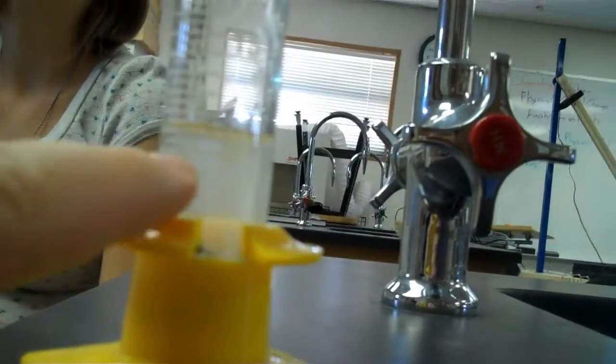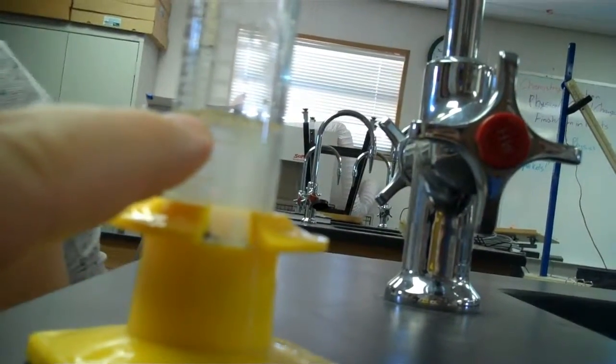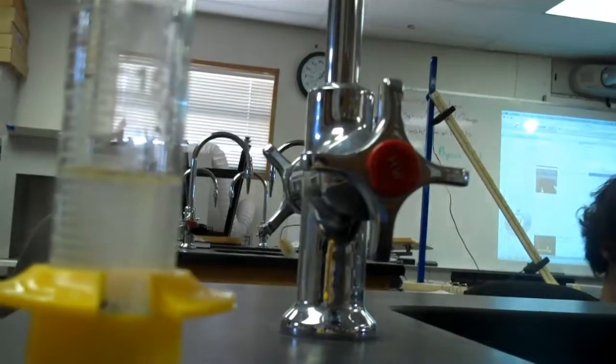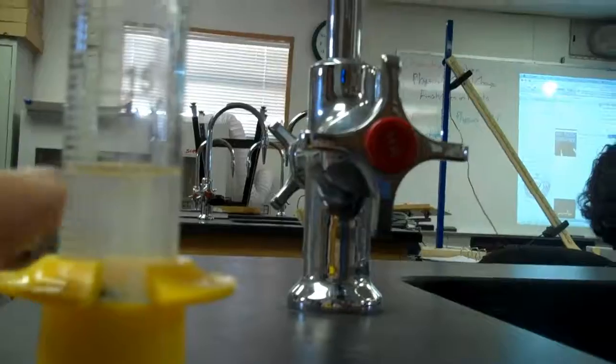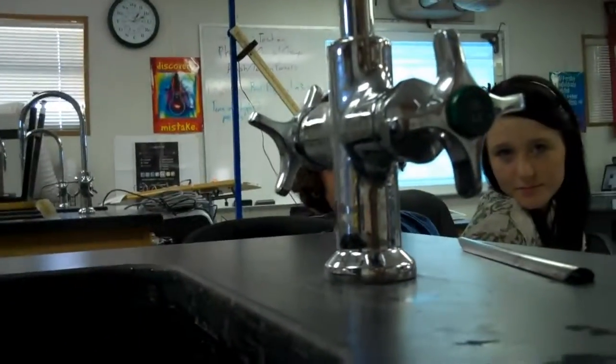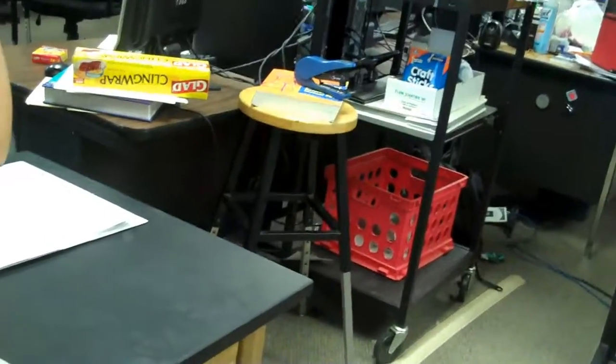We should make Trey do this. Okay, Trey, what's that reading at? Looks like it went up about 3 lines. If you read it from the bottom, it looks like the bottom's right at 11. So it's at 11, so what does that make it? 11 minus 10 is 1. This is zinc. Okay, and the last one, the lead.